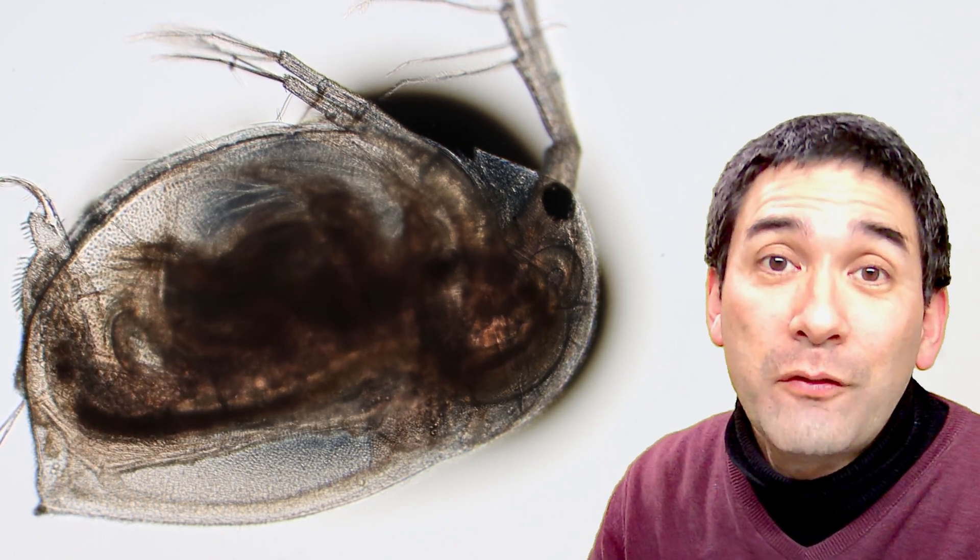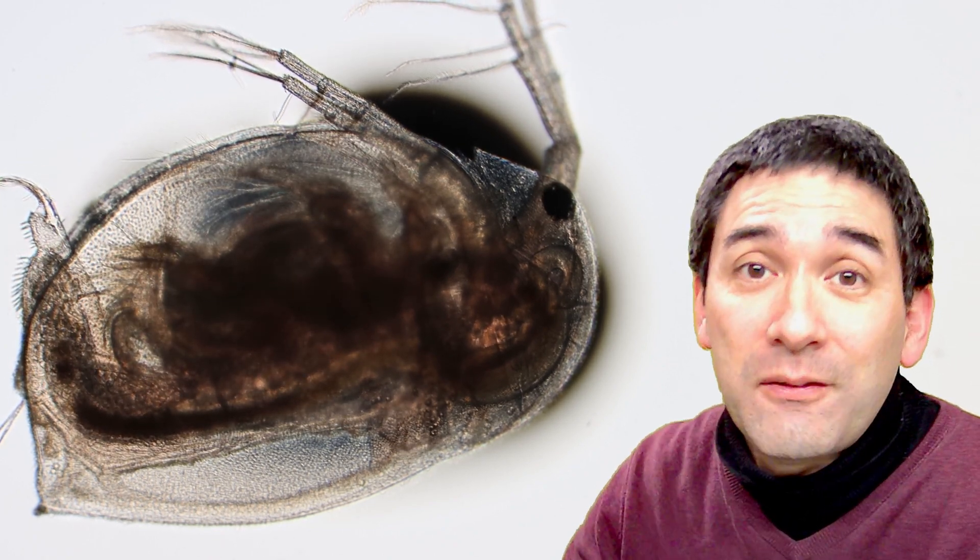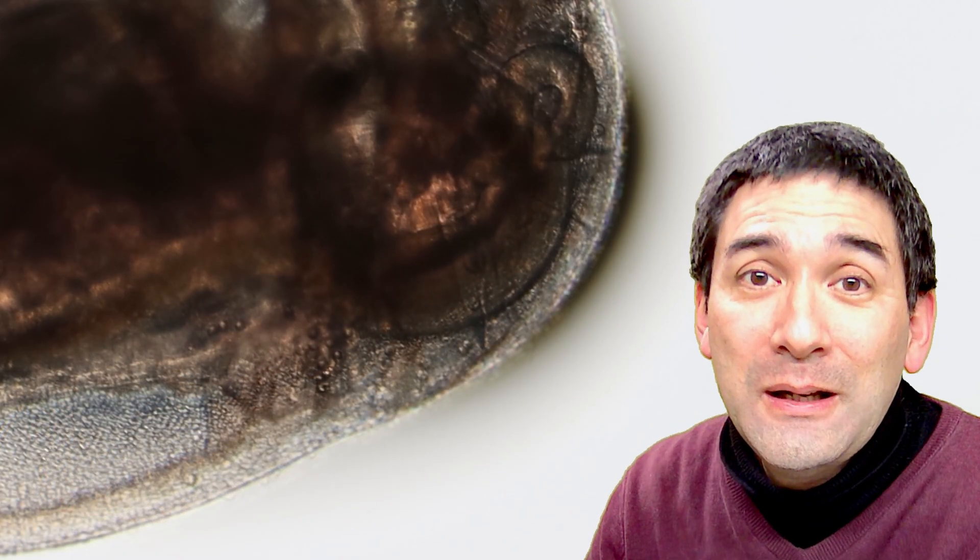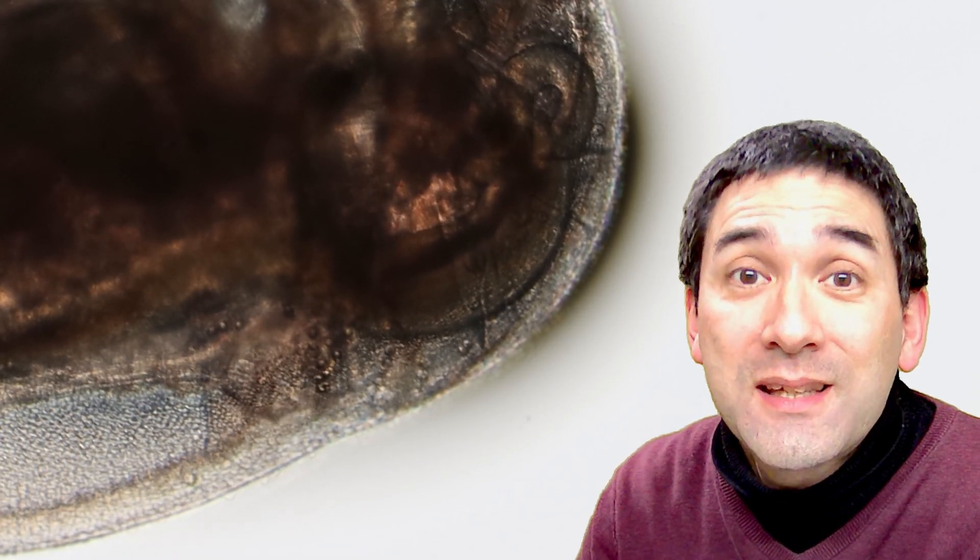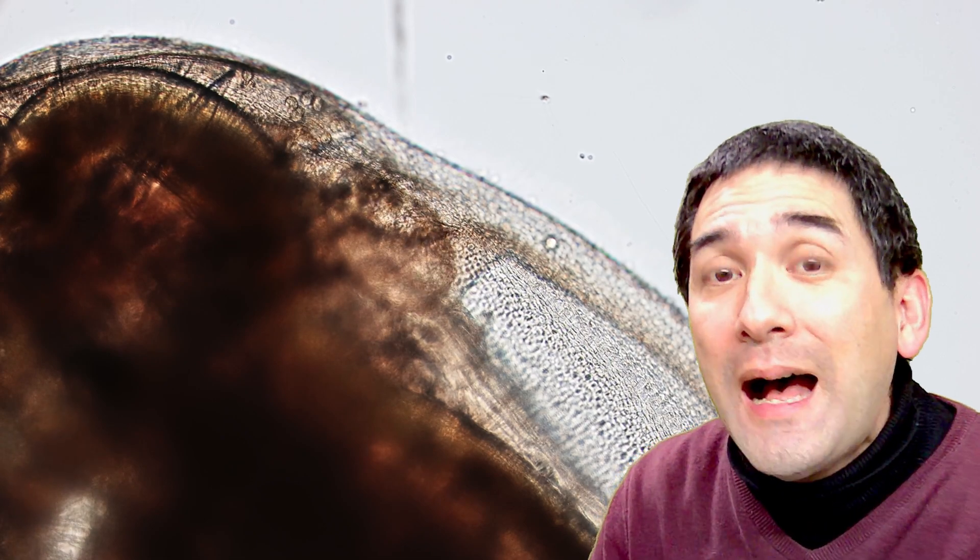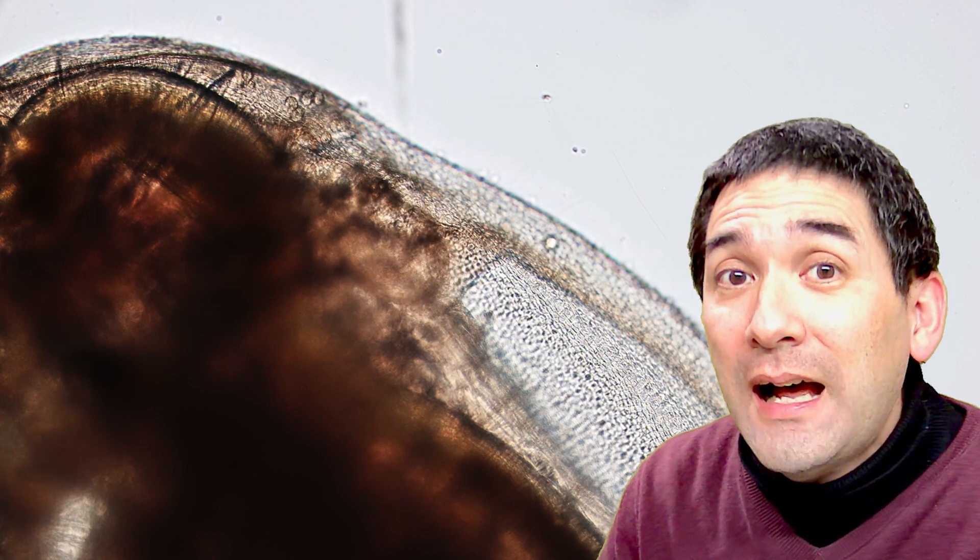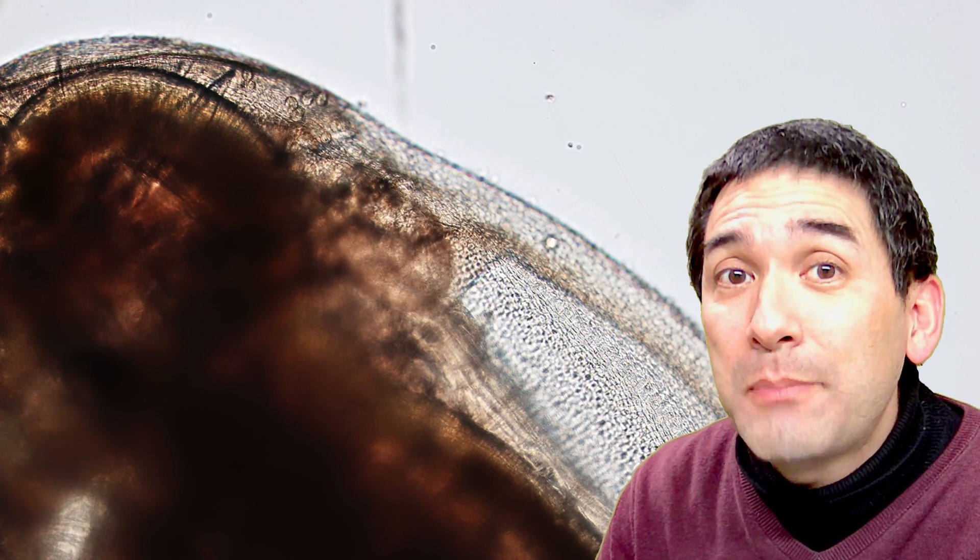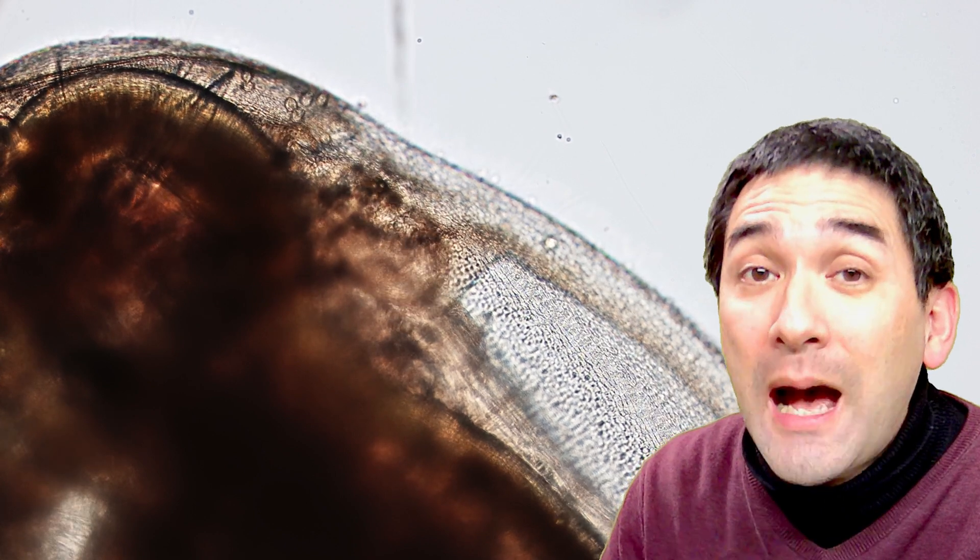Okay, of course I wanted to reverse everything again, so what I've done is I've taken the pipette and I removed all of the excess alcohol and added some water. So I've now added water, and then actually what we expect is we expect the heart to start beating faster again, and indeed this did happen.